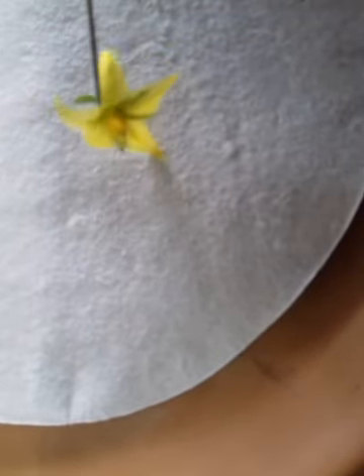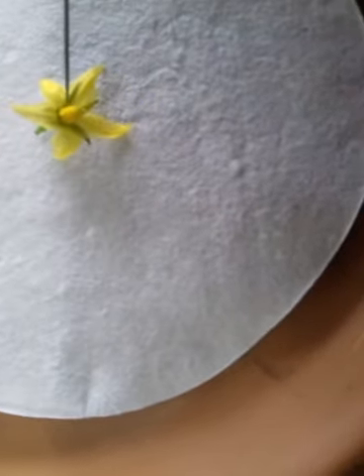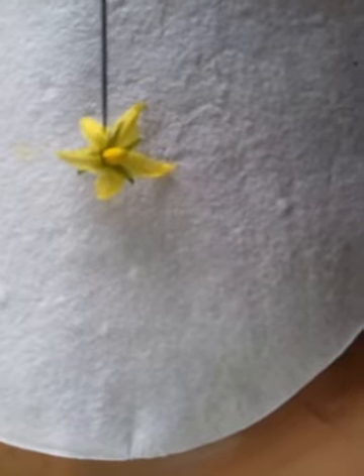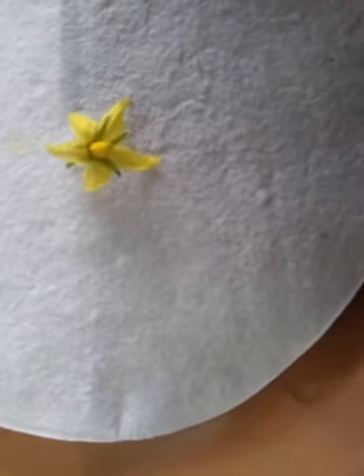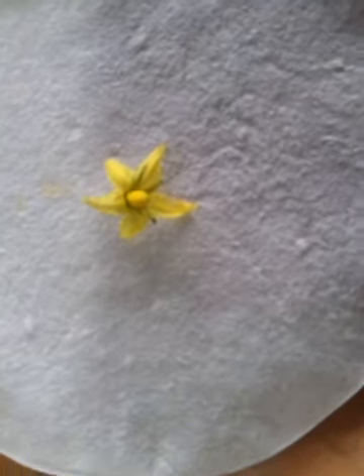and brinjal. Now this is the flower which you can see. Five petals are there, and if you see the reverse side, it's a pedicellate flower. Okay, the presence of these green colored sepals, and you can see here the androecium, it's a polyandrous type of androecium found here. Okay, and gynoecium, of course, we'll see that when we see the dissected flower.